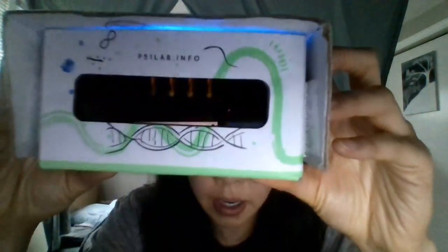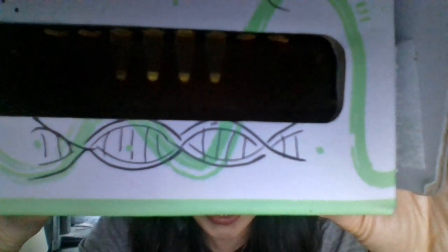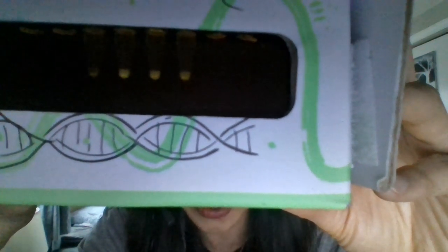Alright, so let's take a look at our tubes now. Put them in the box, turn on the light. Alright, so I'm going to turn the light off here so we can actually see it. And if I hold it up to the camera, yeah, there you go. So you can see that tube number 1 is blank, and that tubes number 2, 3, and 4 are green. So in those tubes, since we see green, it must mean we have RNA and that transcription was successful.